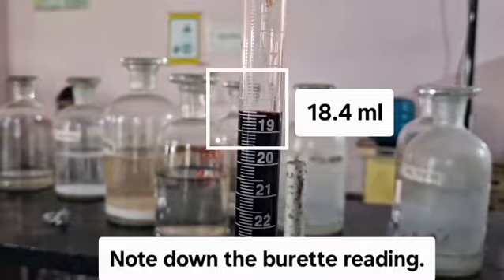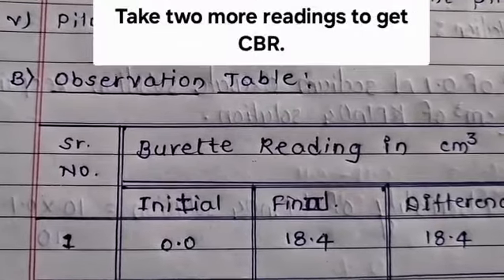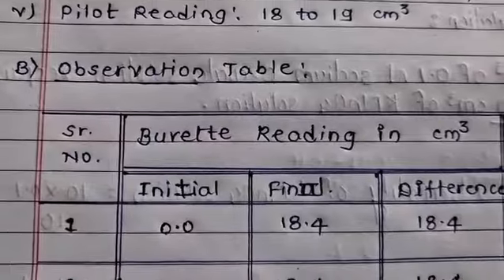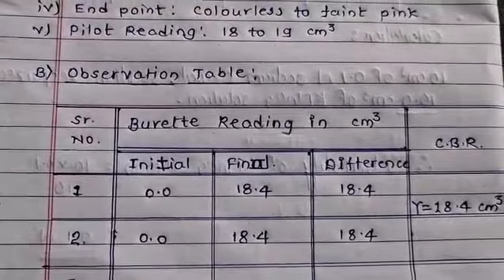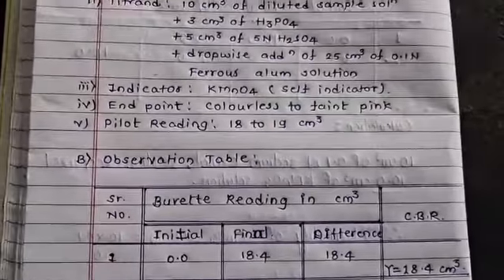The reading is 18.4 cm³. Note down the burette reading in the observation table and take 2 more readings to get constant burette reading. The second reading is also observed to be 18.4. Thus, constant burette reading for this part is observed to be 18.4 cm³.